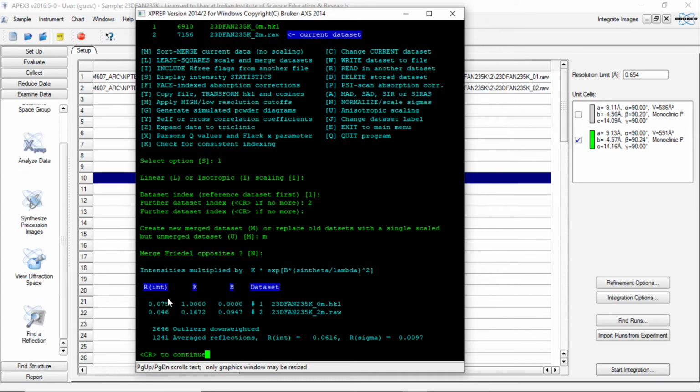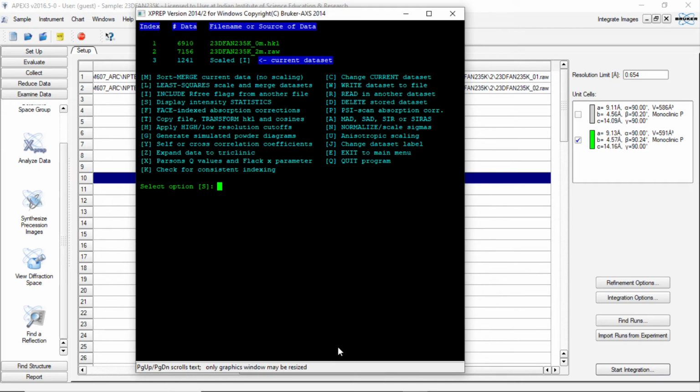So now what we see is that the two files which are in the values of 0.075 and 0.046 are going to be merged, and the overall RINT is going to be 0.0616. So now I have a merged data with 1241 reflections.